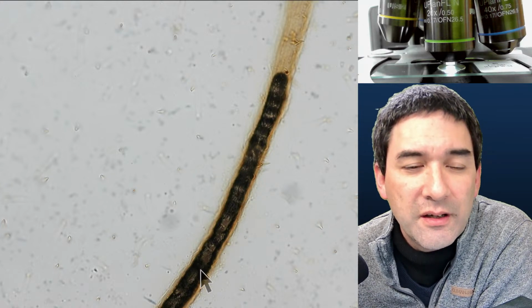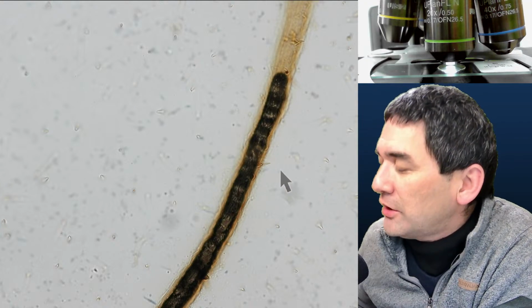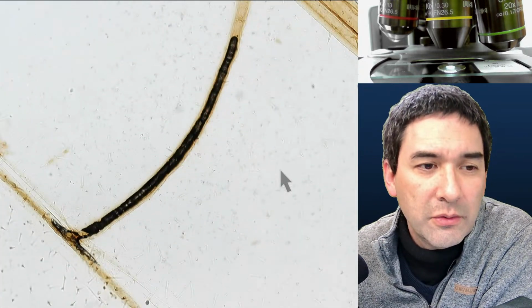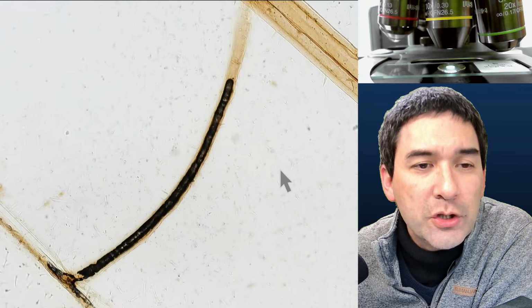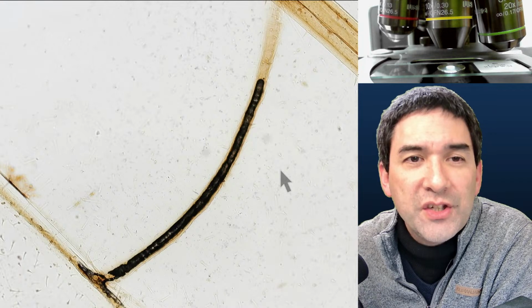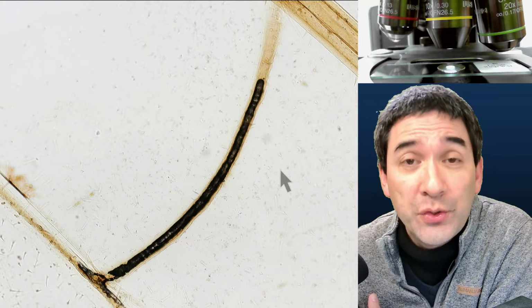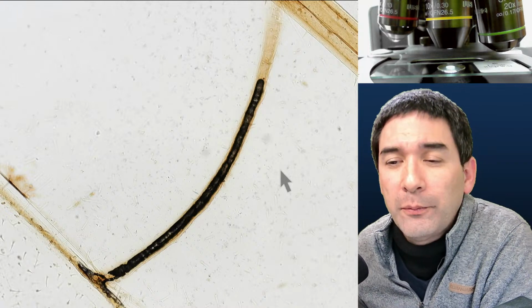So this dark area, even though it doesn't look so nice, is actually an interesting sign which tells you a little about how those vessels are constructed, so that they are hollow. It's also one of the reasons why you want to submerge your specimen first in some alcohol to remove any water and drive any air out, to make sure that later, when you mount it, everything is properly filled up with mounting medium.